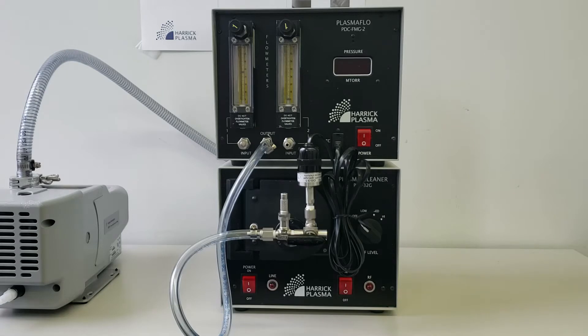We will treat a PDMS microfluidic component and a glass slide at 200 millitorr in air plasma for 50 seconds.